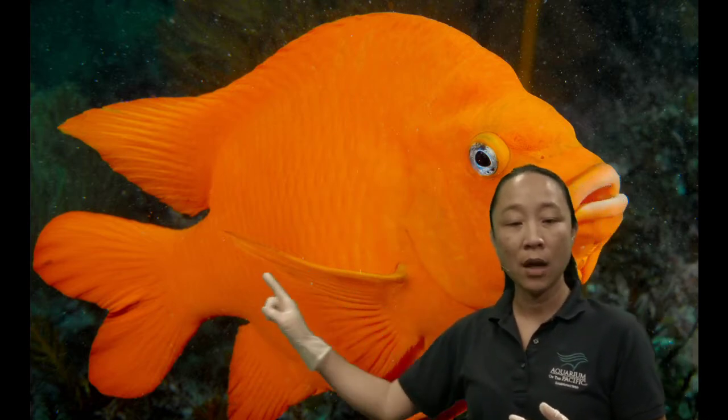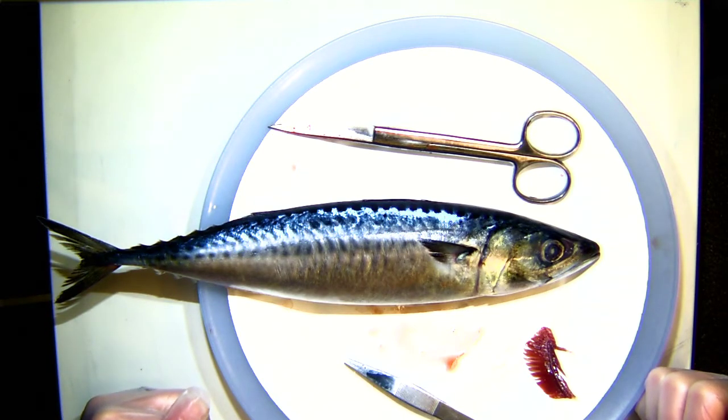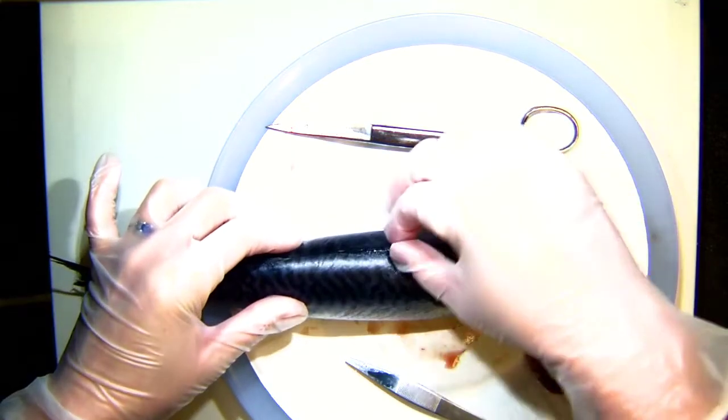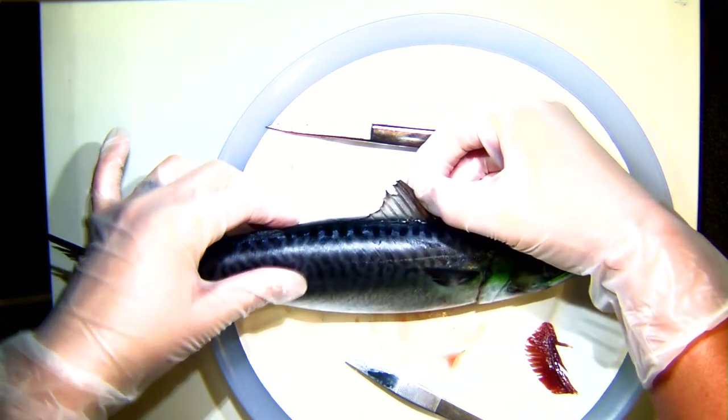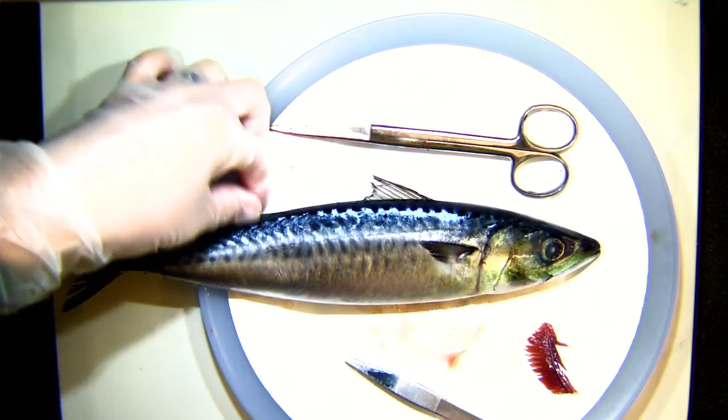So the fin shapes tell you a lot about how this animal moves. We can see the pectoral fin here and the caudal fin here — just like our mackerel but different shapes. Do you notice this giant fin on the Garibaldi? This is their dorsal fin — dorsal is the top side. That gives them stability. Let's go take a look at the mackerel again and try to find the dorsal fin. Well, it's actually quite streamlined right now — the dorsal fin is folded down on its body. Look at this — that's the dorsal fin. It's actually quite large for this fish, and not only does it have this one, it has another little one down here.